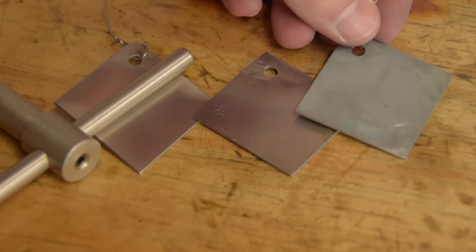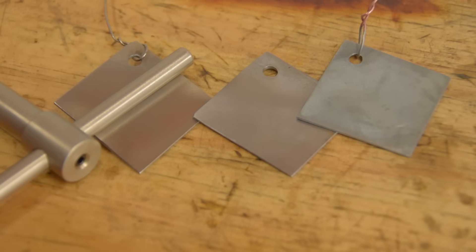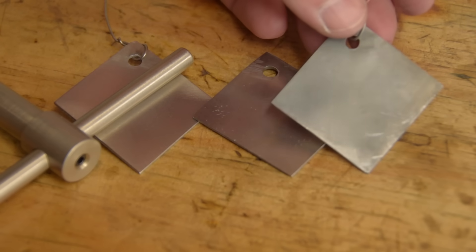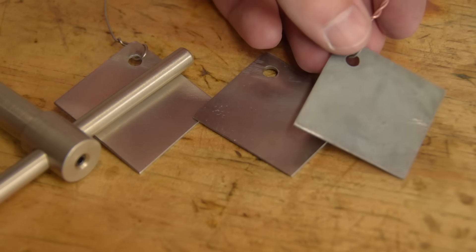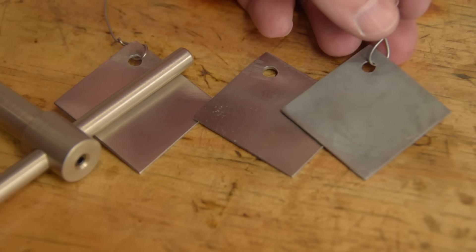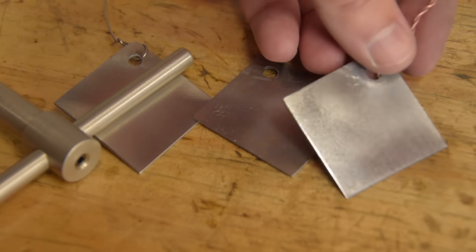Next, zinc. The zinc turned out fine as well. That dull grey is what you're going to get without using brighteners. The dull side is as plated. I gave the other side a quick polish, just by hand with some autosol.